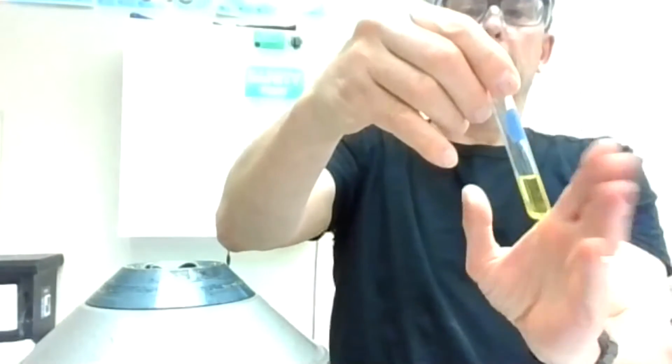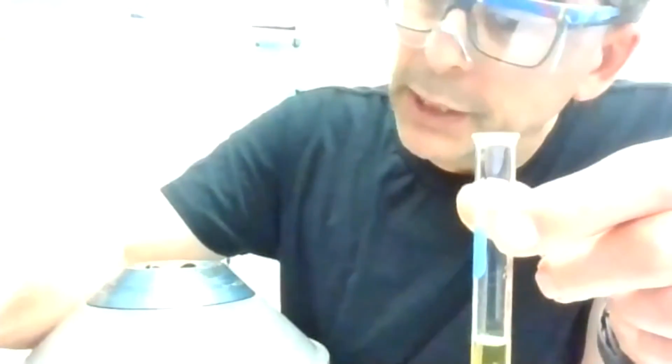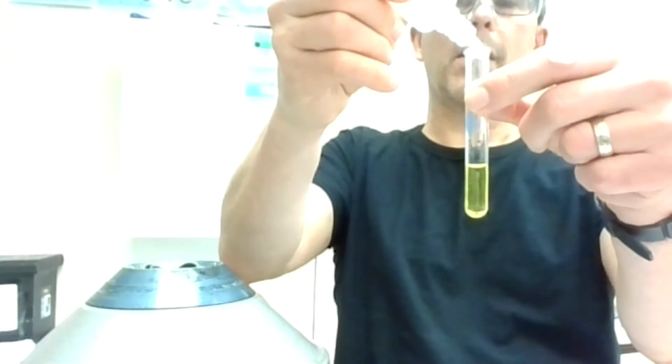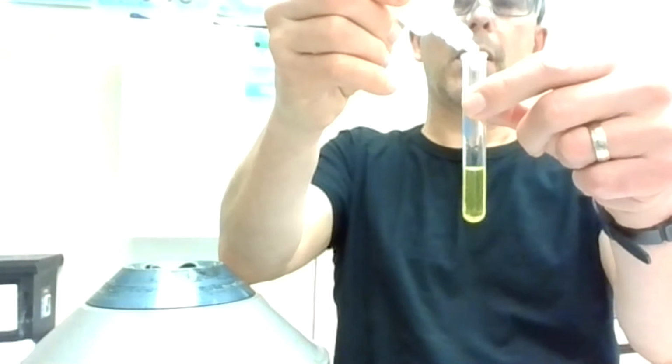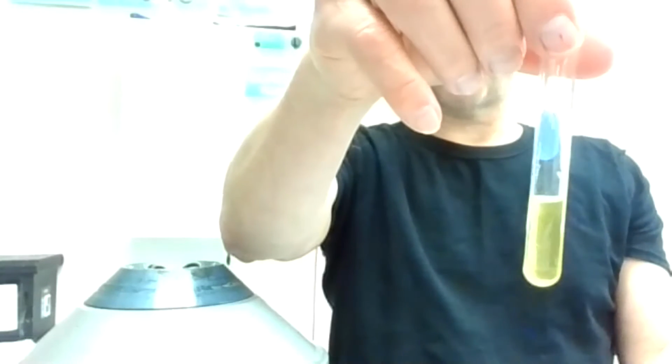A positive test for this would be that it would get cloudy right away. Okay, it's getting yellow, but that's just the color of the solution. No cloudiness. And I think I'm going to just go right to the next step, which is SO4 for this one. And this is one where I add a couple extra drops. And this one is a really difficult one to tell.